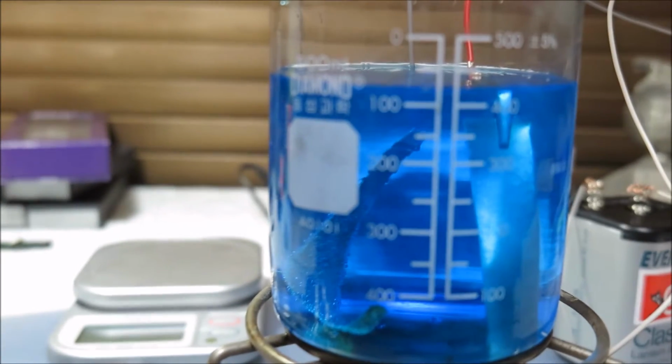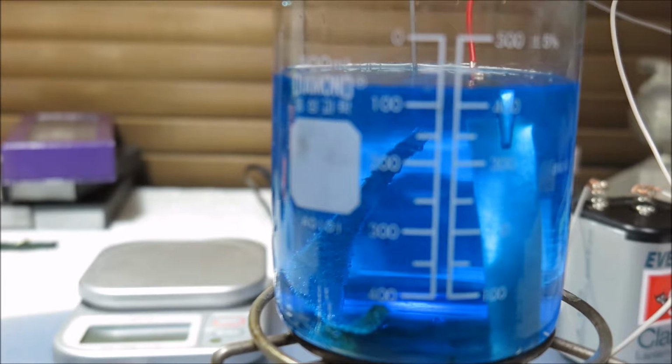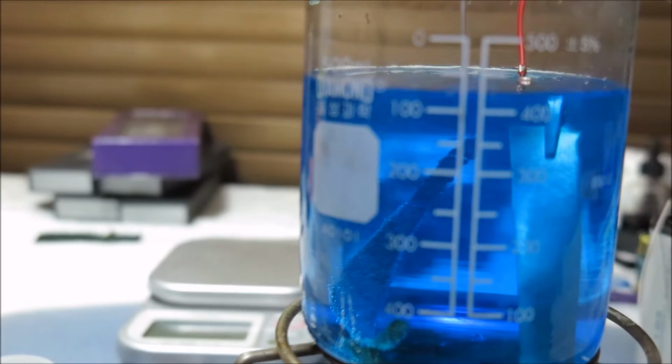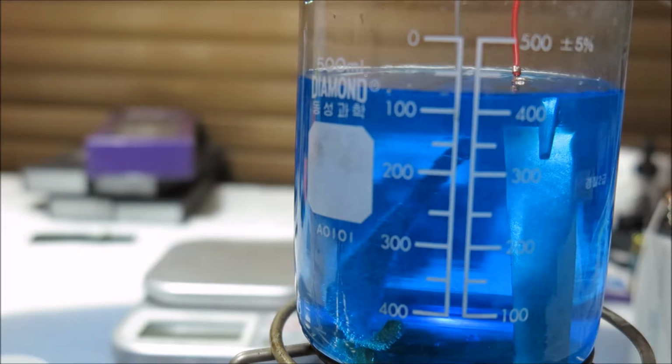So it's not zoomed up on the beaker, it's zoomed up on the anode, which is the gold, and that's good. You can definitely see the bubbles very clear. Yes, it's focused on the cathode and anode, which is a good thing for me. Yep, no, it's completely focused.